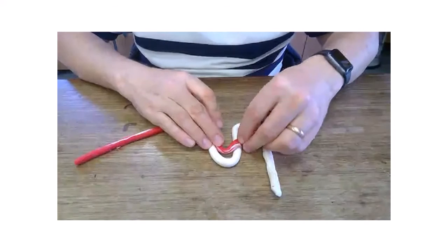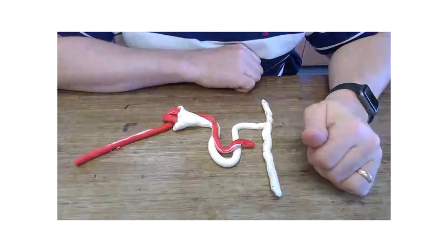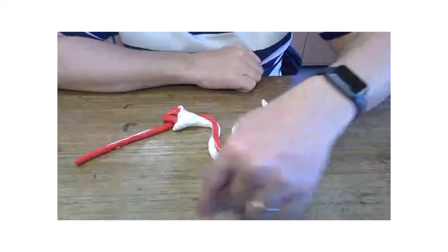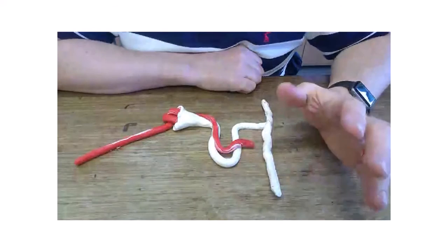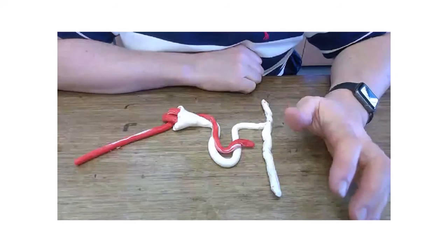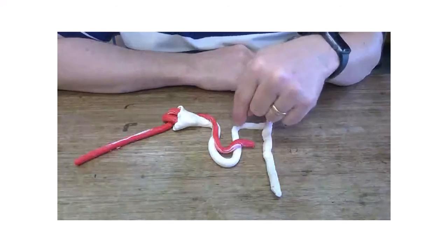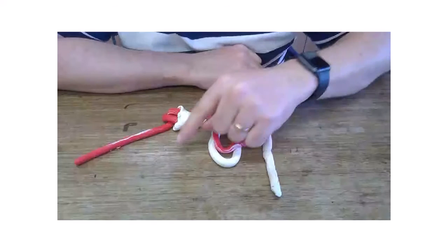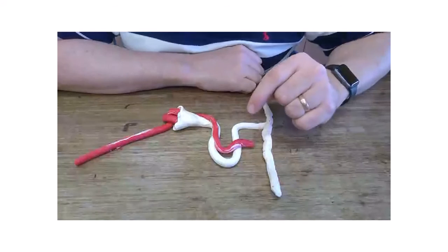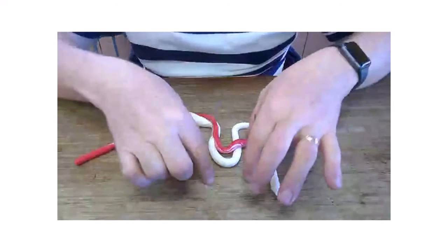What's the bit on the outside of this nephron, where all the things get? That's just tissue fluid of the medulla. So that'll be very salty, because what the loop of Henle does is it pumps out sodium and chloride ions all the time using active transport, and that makes this bit really salty.